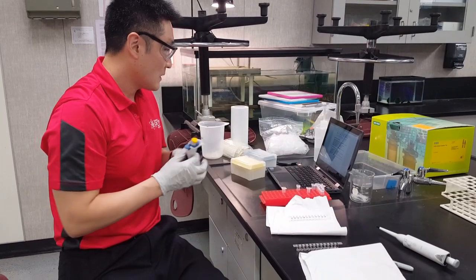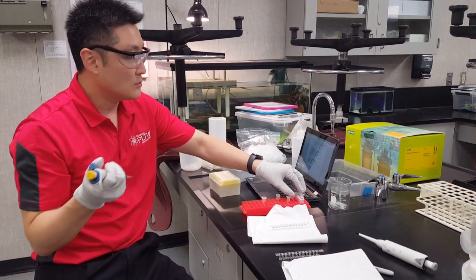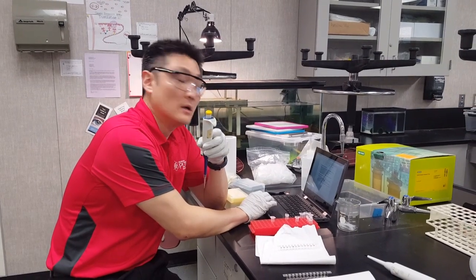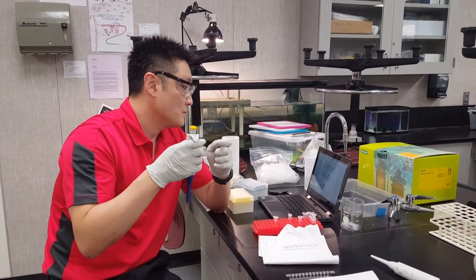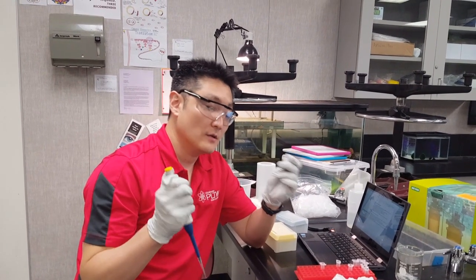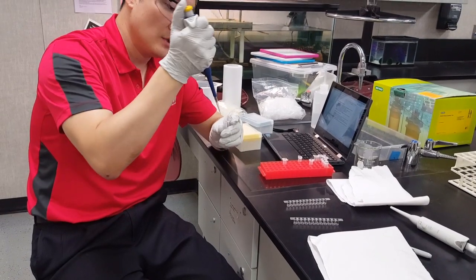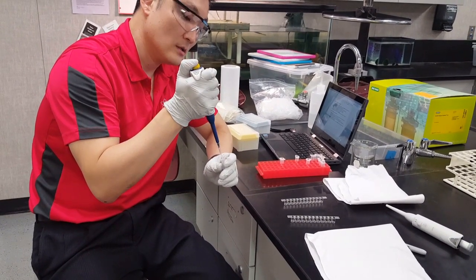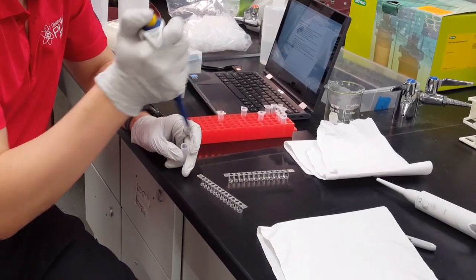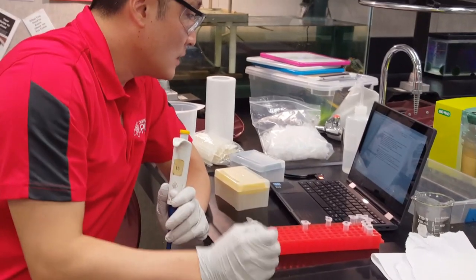Put on a new tip. The wash buffer is labeled WB. Add 100 microliters of wash buffer into every single well — all wells across both strips. You can use the same pipette tip for the wash buffer since you won't be touching any leftover liquid in the wells.